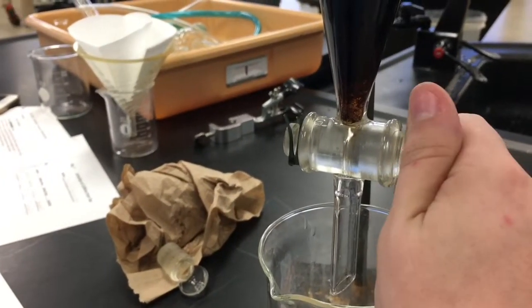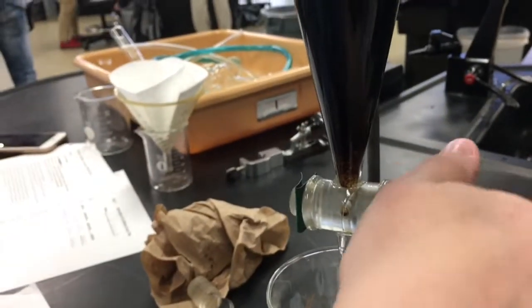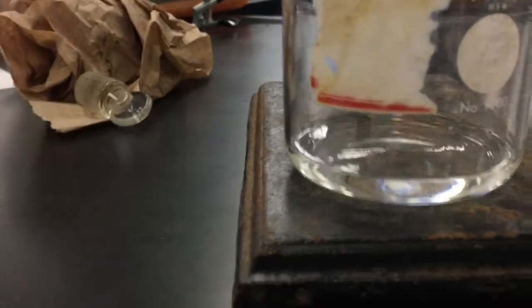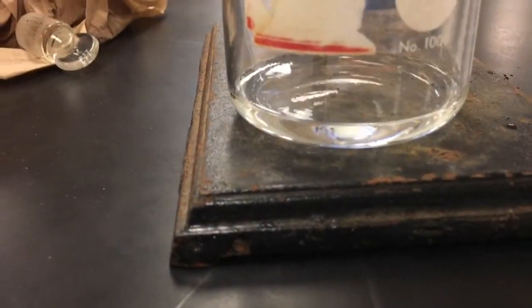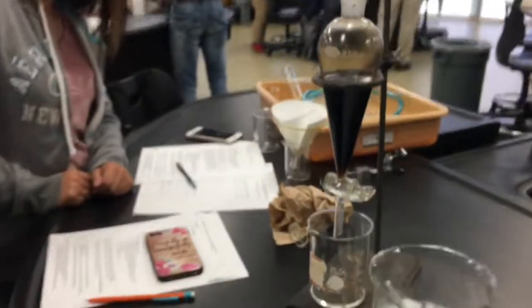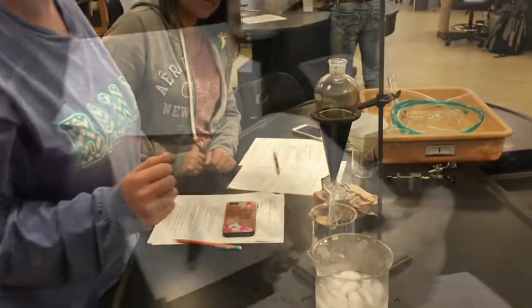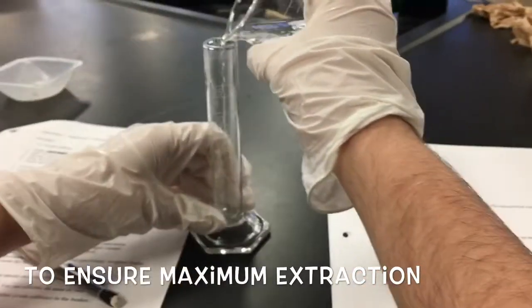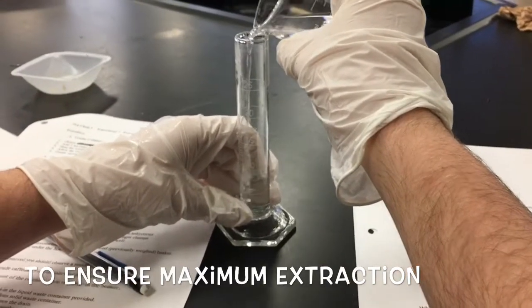It's so cool. Good job — we got it, like little bits. We got a couple of bumps but it will be okay, it'll filter out. So now we put 25 more in it. Lori's going to get a second batch of dichloromethane — 25.